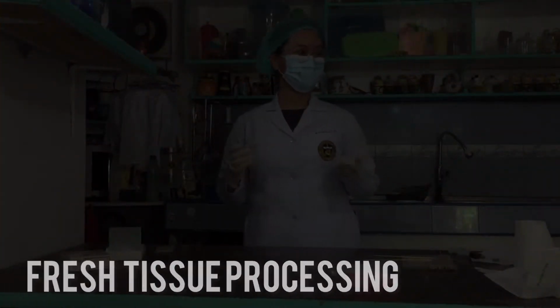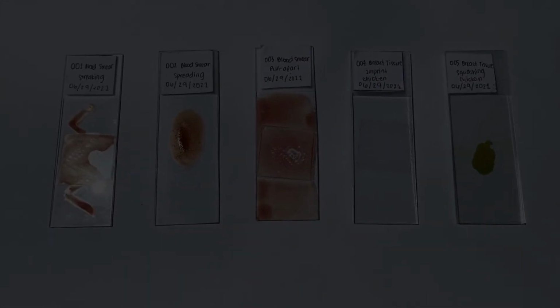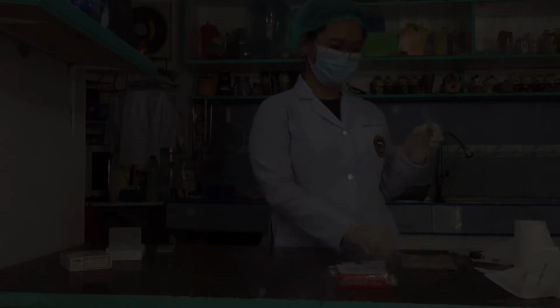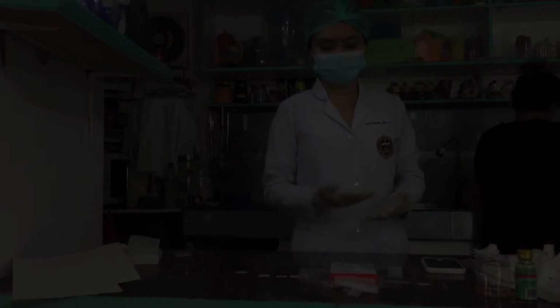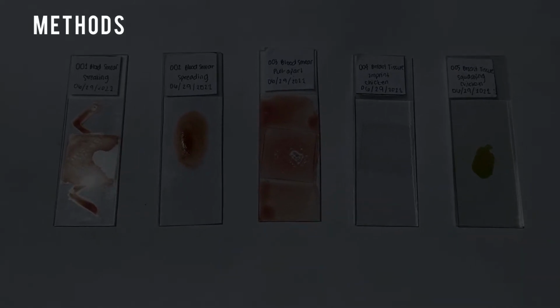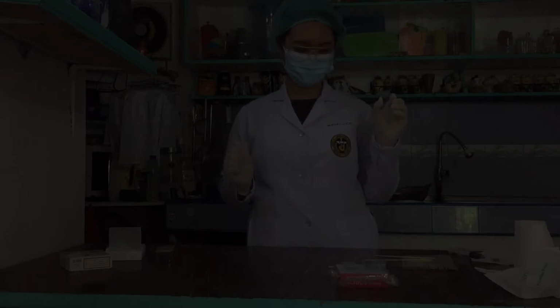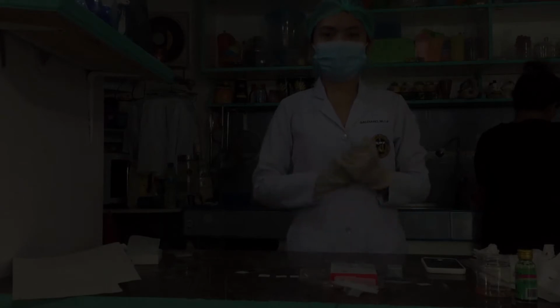Fresh tissue examination is usually done for a rapid microscopic analysis of a specimen while surgery is taking place. Protoplasmic activities such as mitosis and phagocytosis may be observed when tissues are examined in their fresh state. Methods of preparing fresh tissue mounts: teasing or dissociation, squashing or crushing, smearing, and frozen section.